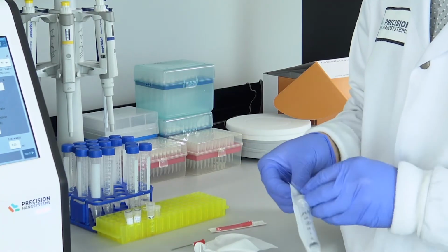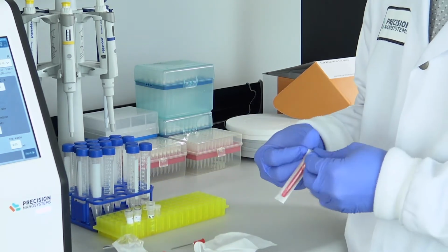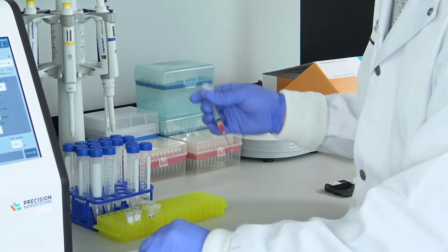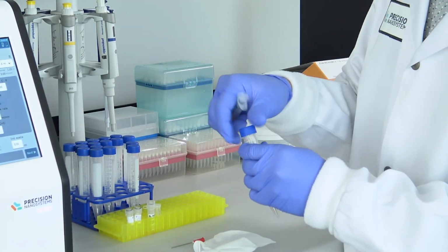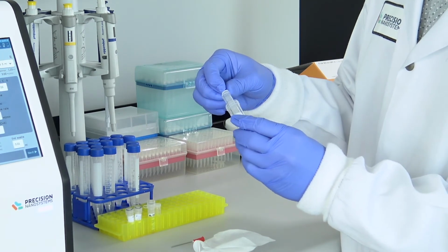The ease of use of the Ignite addresses another appreciable challenge faced by the field, namely assembling or training a workforce skilled in the art of making LNPs. The Ignite lowers the barriers to successfully formulating nanomedicines and reduces human error. This means you don't need to spend years in the lab perfecting a technique.